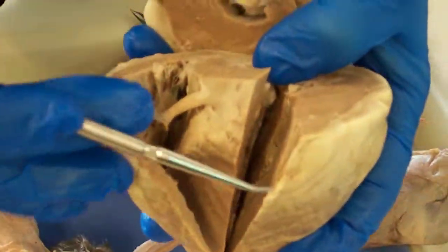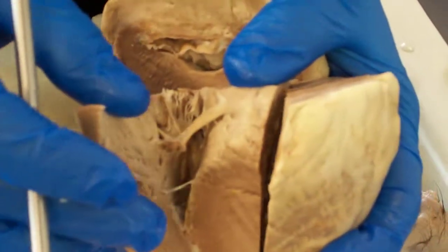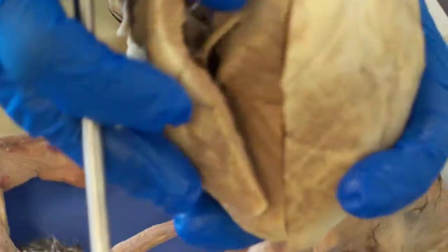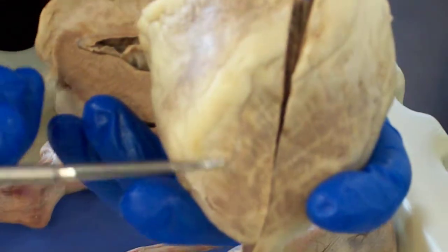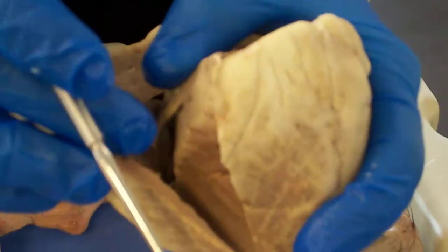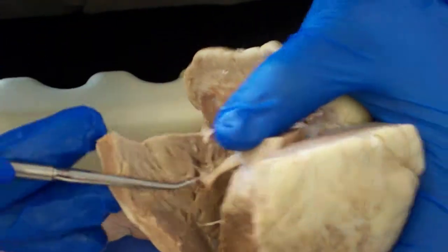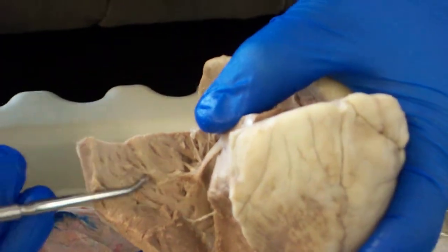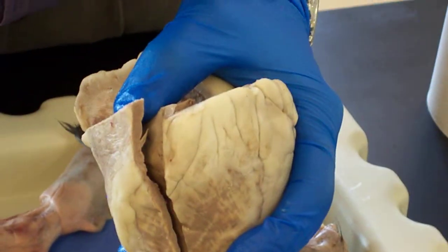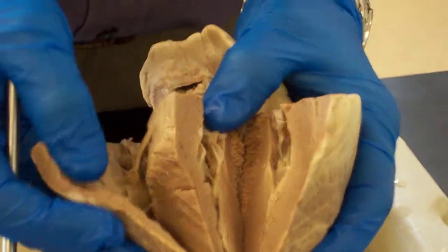We can see the tricuspid valve that leads into this right ventricle. The myocardial wall of the right ventricle is pretty thin. If we look closely on the edge of the heart, the outside layer is the epicardium, the wall in the middle is made of myocardium, and then the muscle on the very inside layer of the chamber is the endocardium.